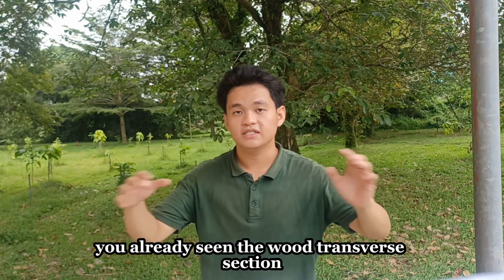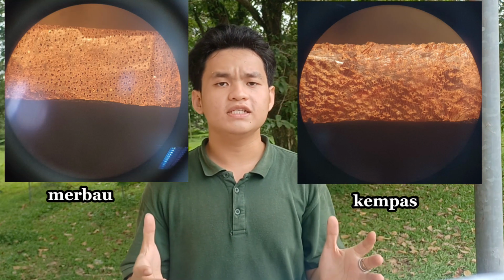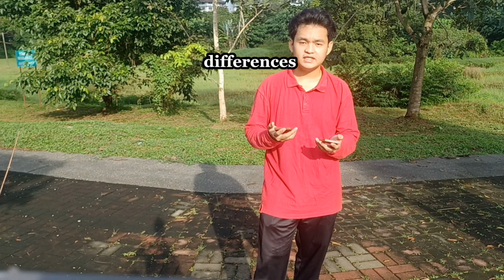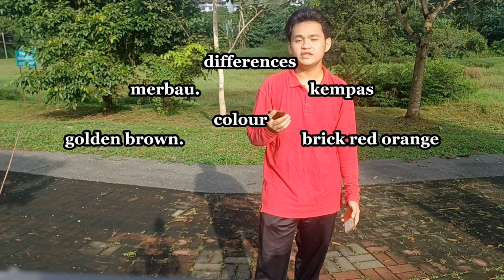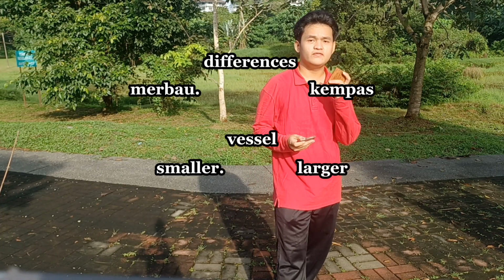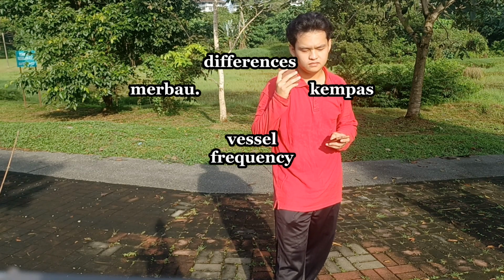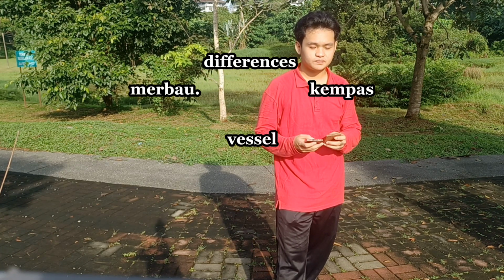So now we have seen the transverse section for this wood and this wood. This is kempas, this is merbau. You might be wondering what the differences between them are. First of all, the colors are not the same. Kempas is brick red to orange, meanwhile merbau is golden brown to dark red brown. After that, we go to the vessels. The vessels of kempas are larger than the vessels of merbau, and the frequency of merbau vessels is higher than the number of kempas vessels.